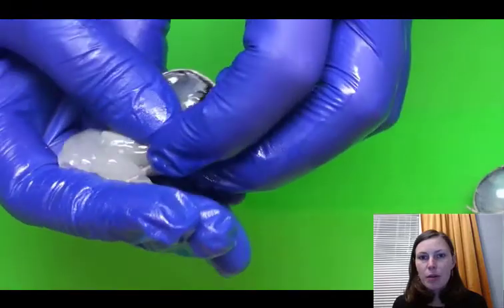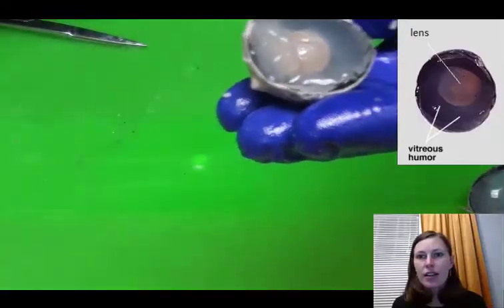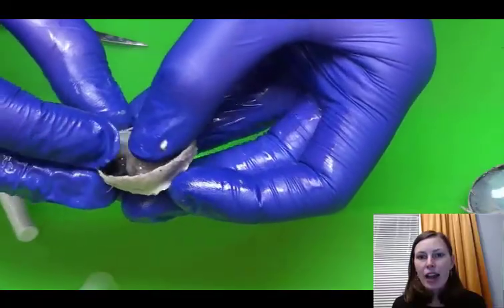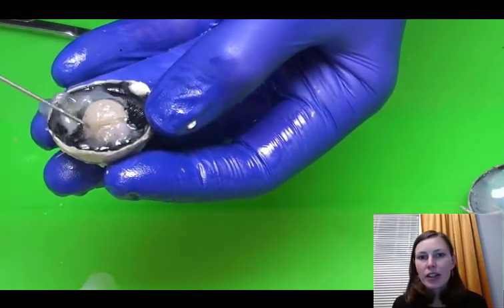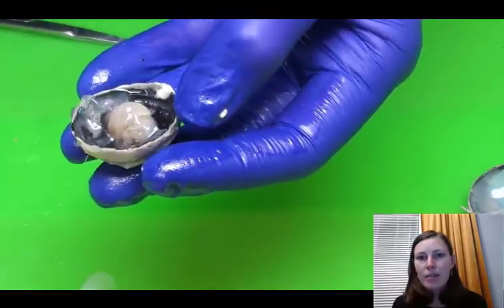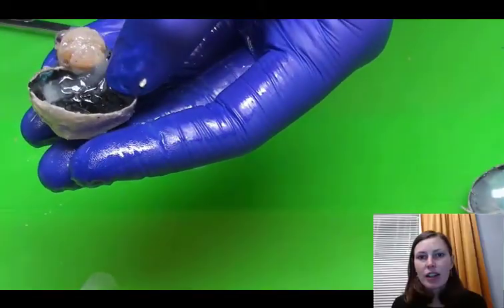We want to get rid of the vitreous humor so that we can look at the deeper structures. So we're going to pull it out of the anterior half. There you see it. And now you can see kind of through the vitreous, you have the lens that you can see. That's that white, darker structure. We need to pull the lens out. And the lens, though, remember, is connected to those zonular fibers, and so those zonular fibers are holding it in. So it takes a little bit of effort to kind of pull out the lens, separate it from the ciliary body. But when you do, you can see the lens as separate.